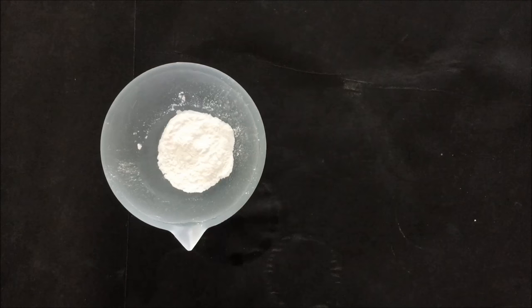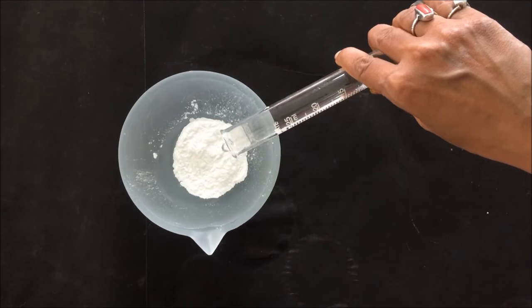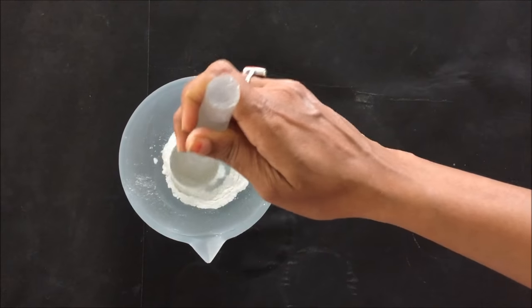Here we have taken 5 grams of silica gel G into the glass mortar and pestle, and then add about 12.5 ml of distilled water and then mix it with the pestle to prepare slurry.